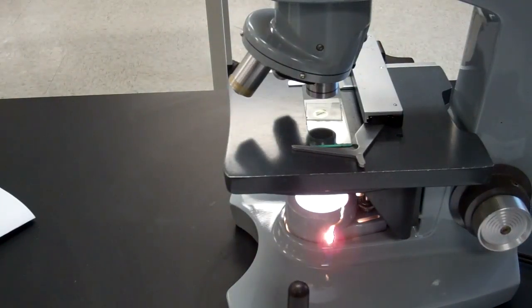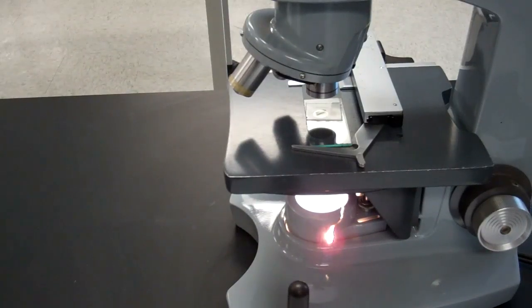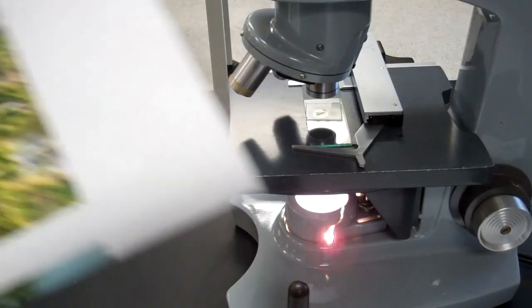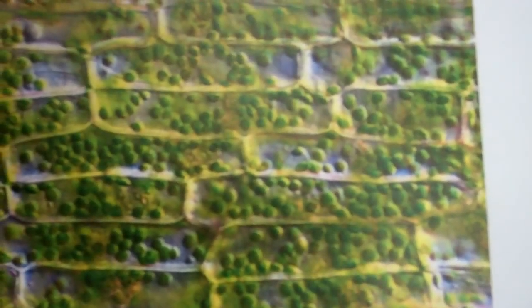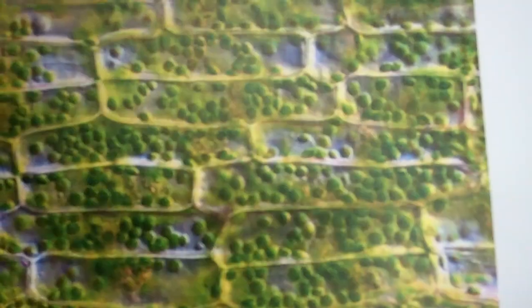So now you would be looking in your microscope and drawing structures. You should look for the cell wall, which is, of course, the outer boundary of the cell. Right inside the cell wall would be the cell membrane, which is pressed right up against the inside of the cell wall. And, of course, the chloroplasts. So you should be able to label those structures.